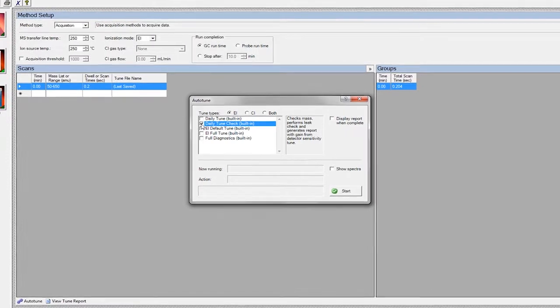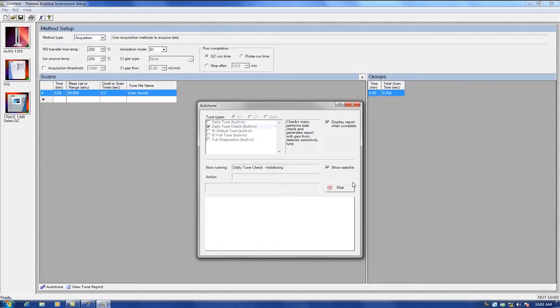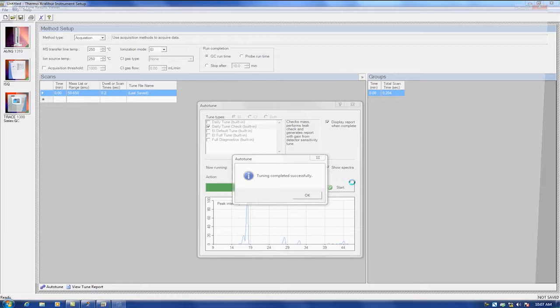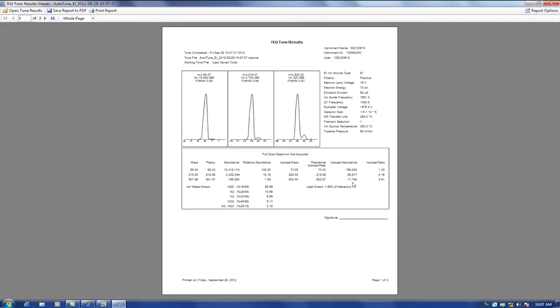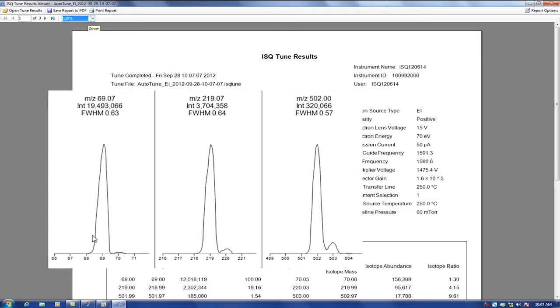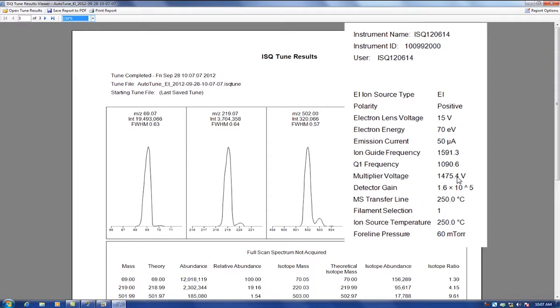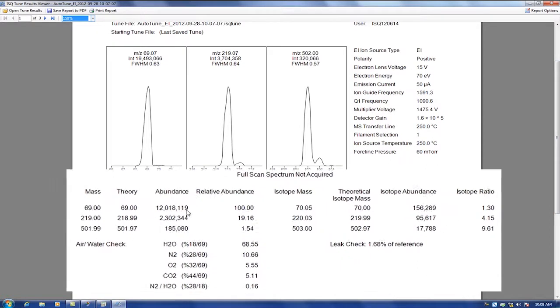Let us observe daily tune check. When tune is finished, the tune report will automatically be generated. The report will display the major characteristic ions. The characteristic and isotope peak shape need to be smooth and well-defined. Compare the multiplier voltage to the last time the instrument was tuned. If the voltage increases dramatically, then perform source maintenance.